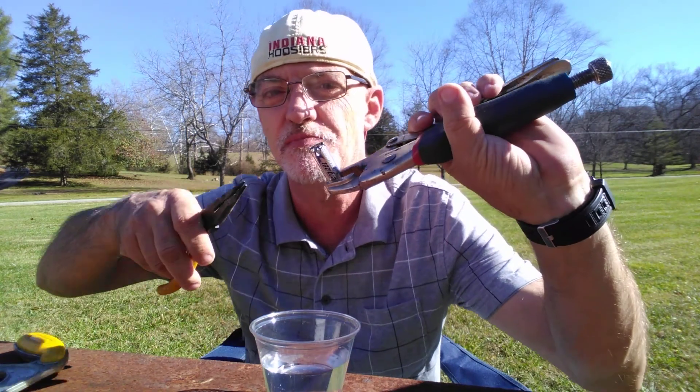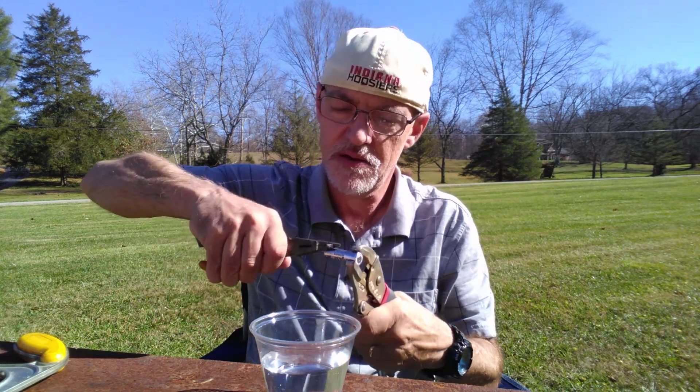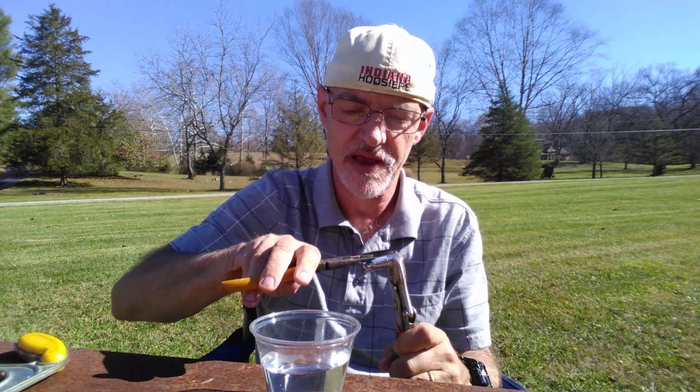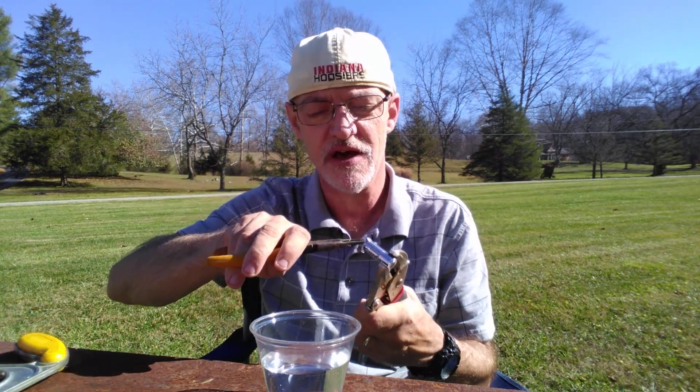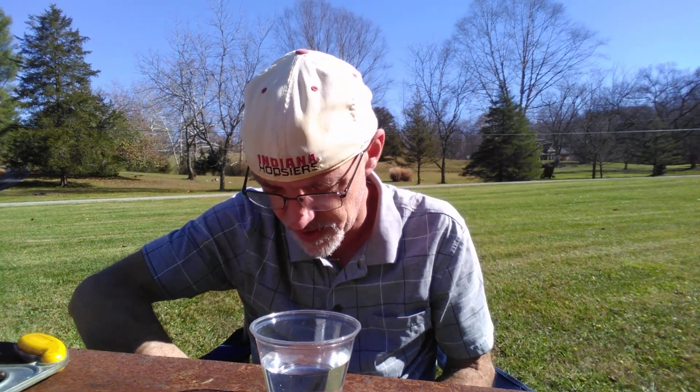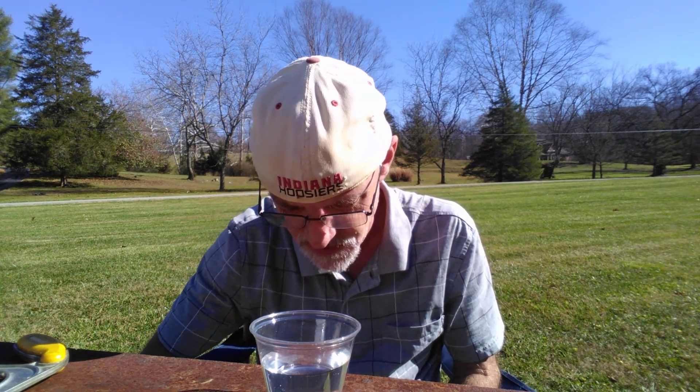See, now I'm starting to peel away part of the casing of the battery. And sometimes if you're lucky, you can pull the lithium out pretty quickly. Other times it's quite a struggle. So we'll see how the one I'm dealing with today reacts.